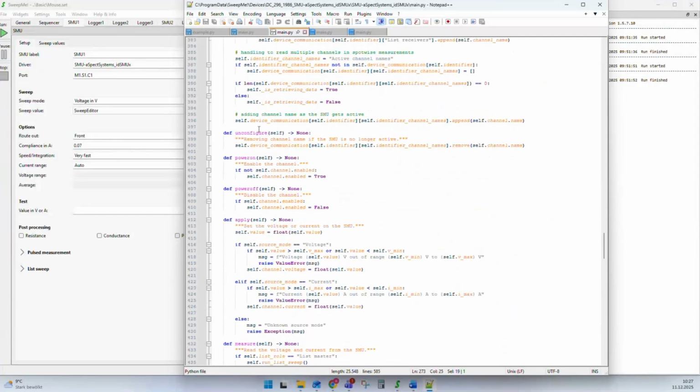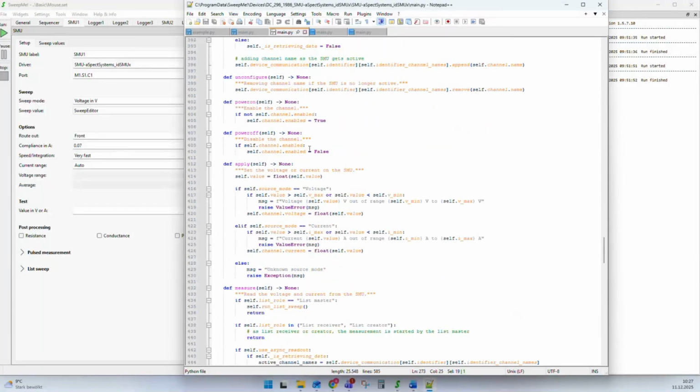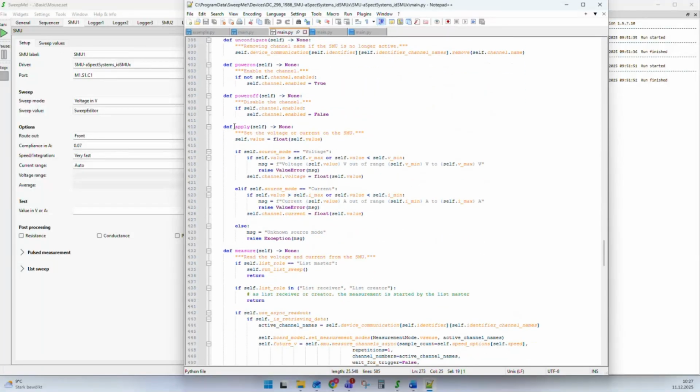Then we have here also some functions like power on and power off. And here you can see the apply function. We hand over the new set value as self.value. You can transform it into your preferred data format, like a float. And then, for example, in this code, it is done like this: if the source mode is voltage, we use the voltage command to send it, like self.channel.voltage is float of self.value. If it is a source mode like the current, so we want to apply a current, then we use self.channel.current here in this library for this instrument to set the new value.